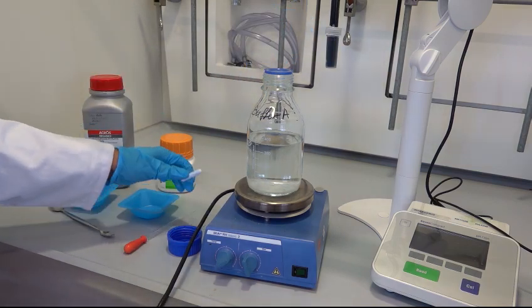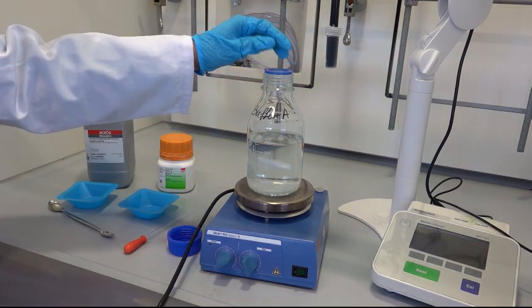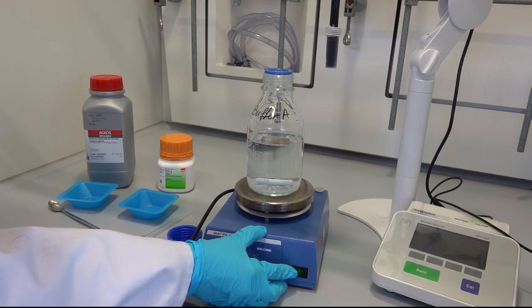Add the magnetic stir bar and turn on the magnetic stirrer. Wait until all the granules are dissolved.